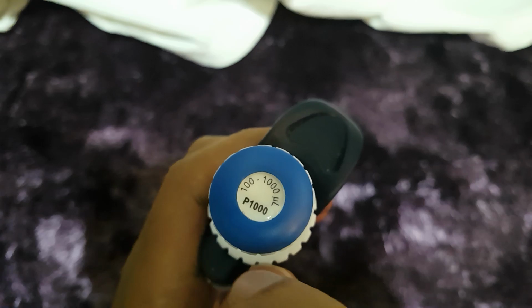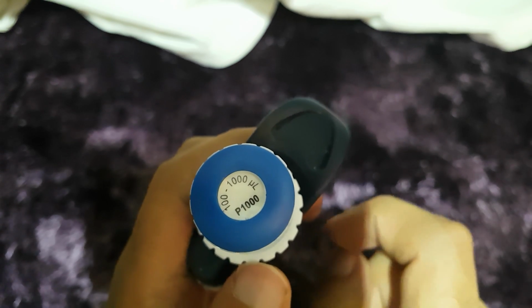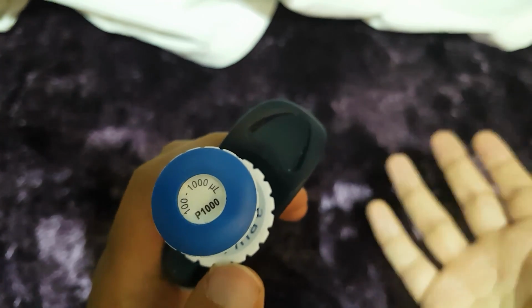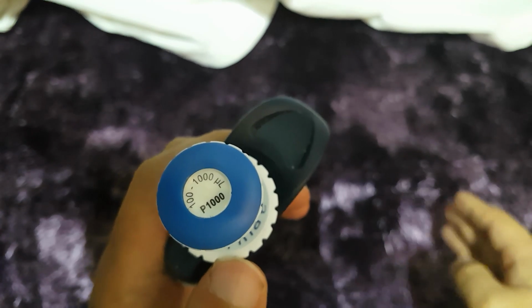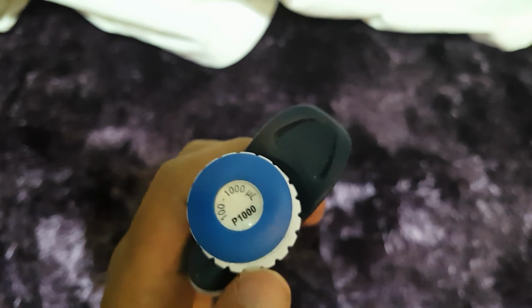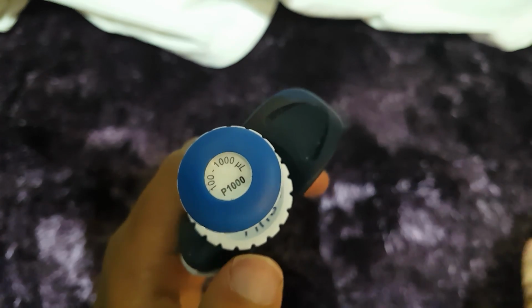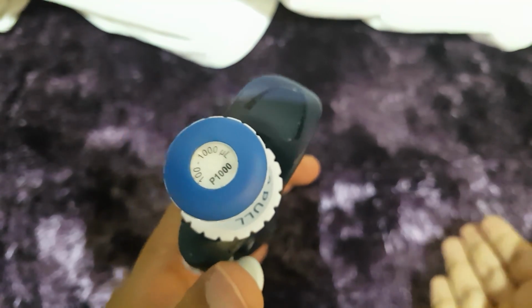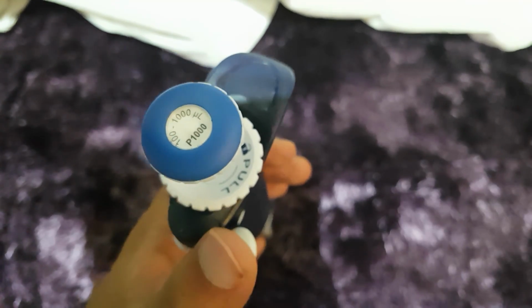This means it can go between 100 microliters and 1000 microliters, or 1 milliliter. You also get a P200, which is between 20 and 200 microliters, a P100, which may be between 10 and 100, a P20, which may be between 2 and 20, and a P2, which may be between 0.2 microliters and 2 microliters. So there's a wide range of pipettes, but basically what you're going to be using here is the P1000 pipette.